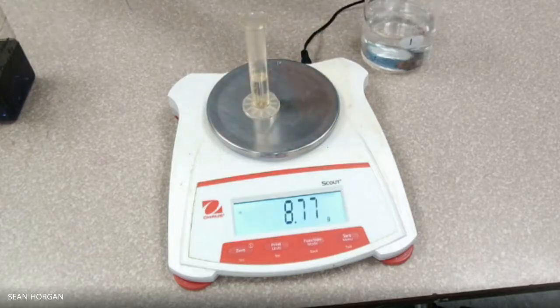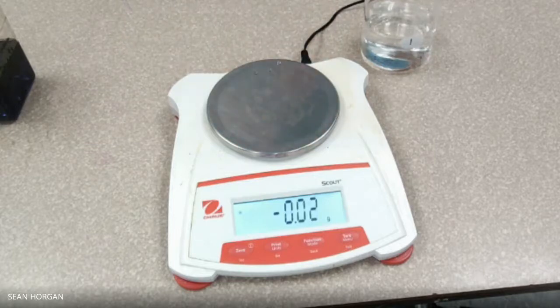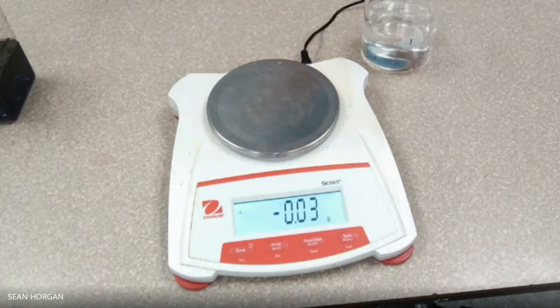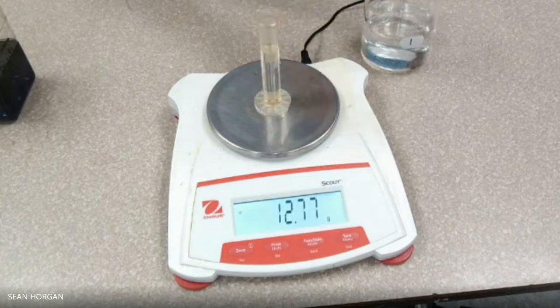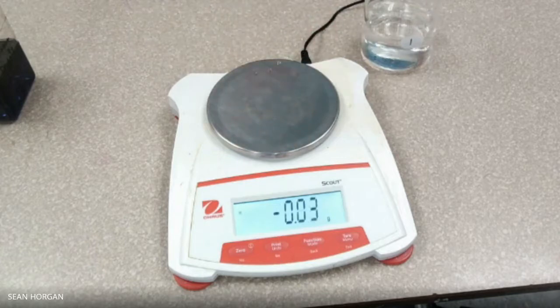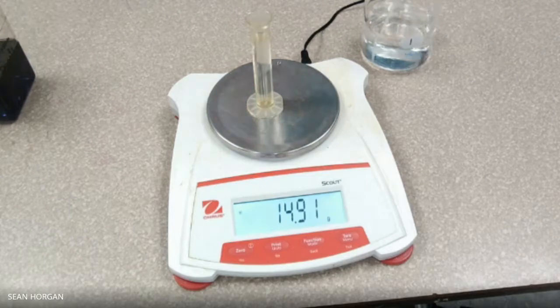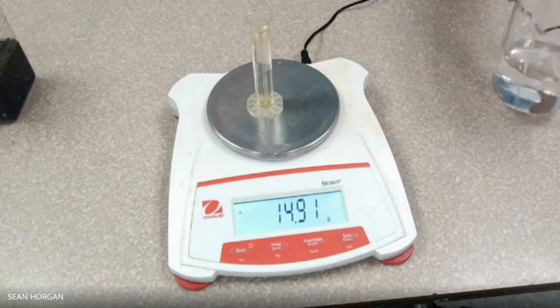Four milliliters. Six milliliters. Eight milliliters. And ten milliliters. So that's what we know — that's the water. We're going to use it to figure out its density, which is what we call an intensive property, which means it doesn't matter how much you have — it should be consistent.